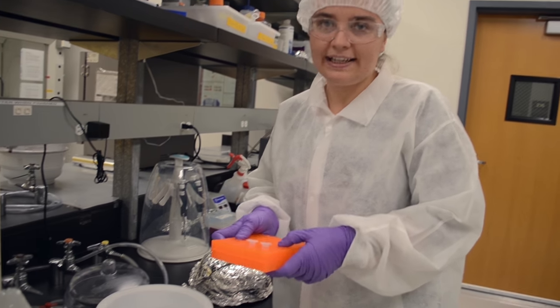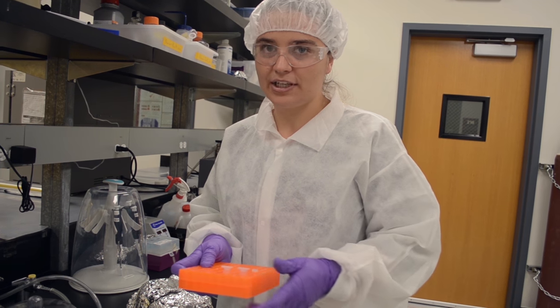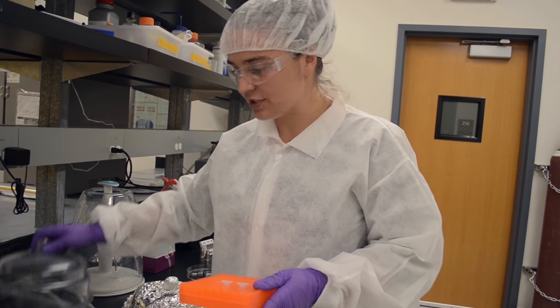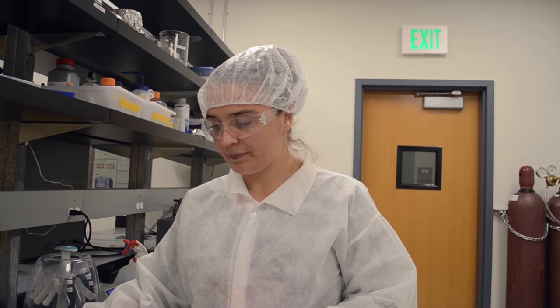And the reason we degas is because if any air gets into the gel while it's polymerizing, it will stop the polymerization process. So we want to get rid of as much air as we can. Can you tell me what polymerization is? Yeah. That's when the gel is gelling. Okay. When it's going from a liquid to a solid.